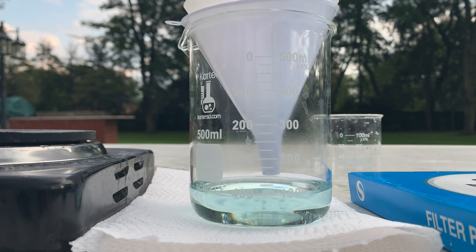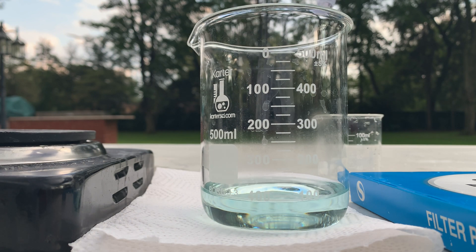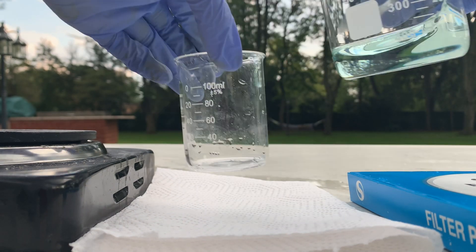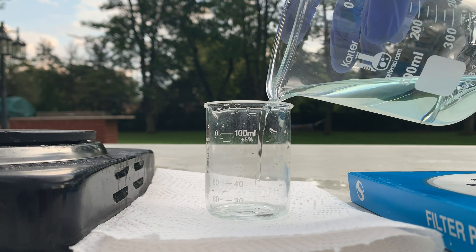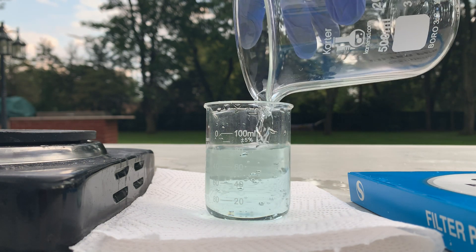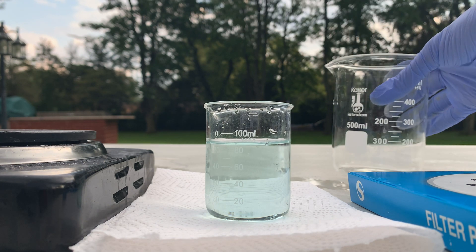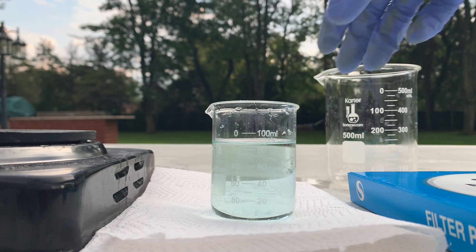What I think I'm going to do is transfer the liquid to another beaker and then boil off all the excess water, and hopefully get some copper salicylate crystals. Yeah, that's a nice light green right there. I'm going to throw this on the hot plate and heat it up a bit.